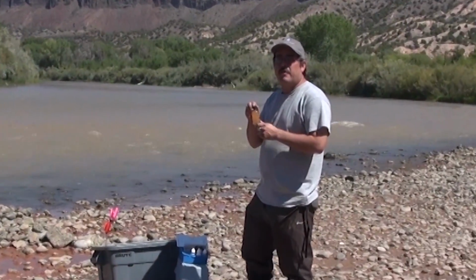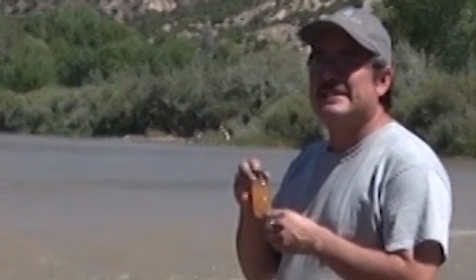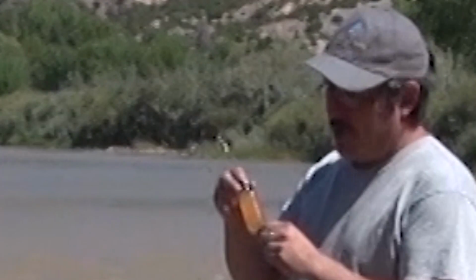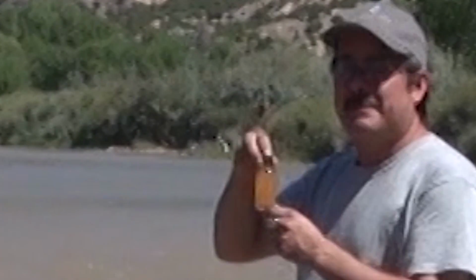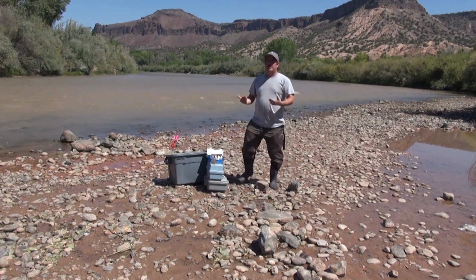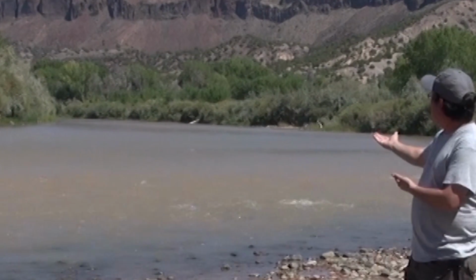The brown material that we formed within our dissolved oxygen sample is what's known as a precipitate. It's a solid chemical structure that has formed within the water. What we'll find is that precipitate is heavier than the water, and so we need to allow some time for that precipitate to settle. So we'll set this down here and give it a few moments to settle. While we're waiting, we can talk about where the dissolved oxygen comes from in the water and why it is important for the fish that live within this water.